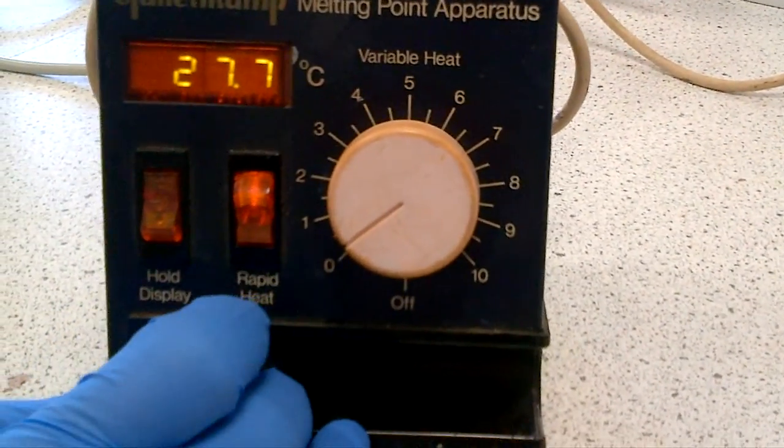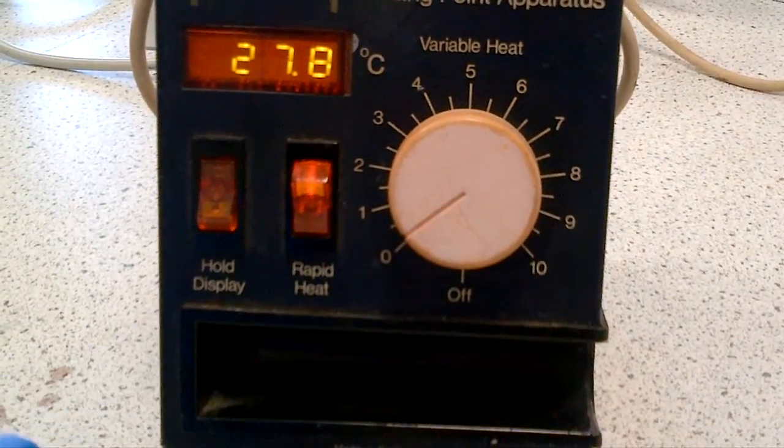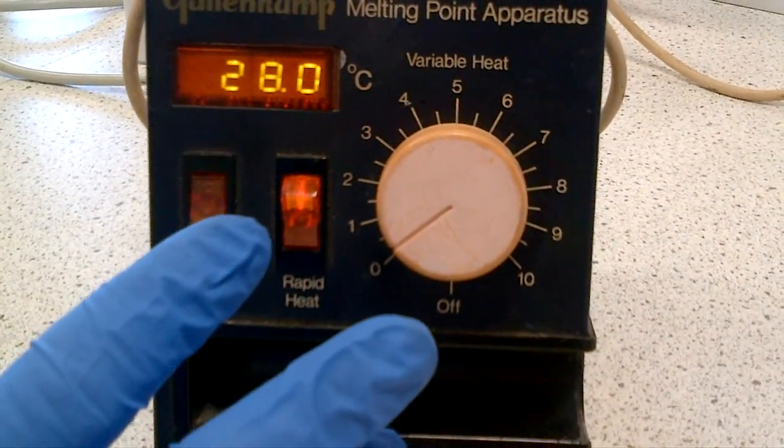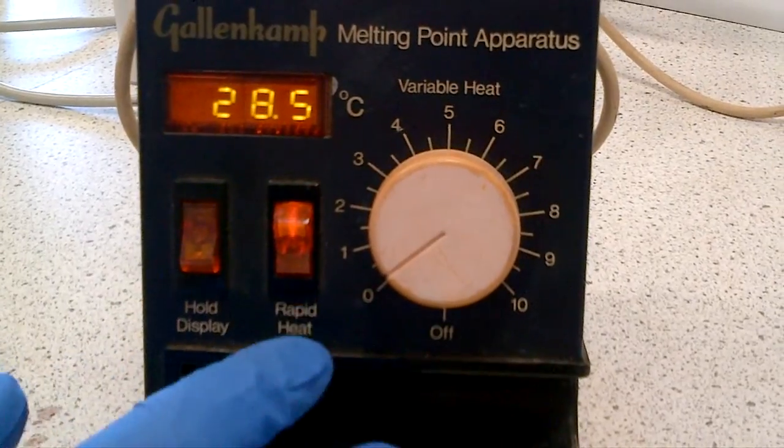And by switching rapid heat on, current is fed into the melting point, and it just keeps heating.